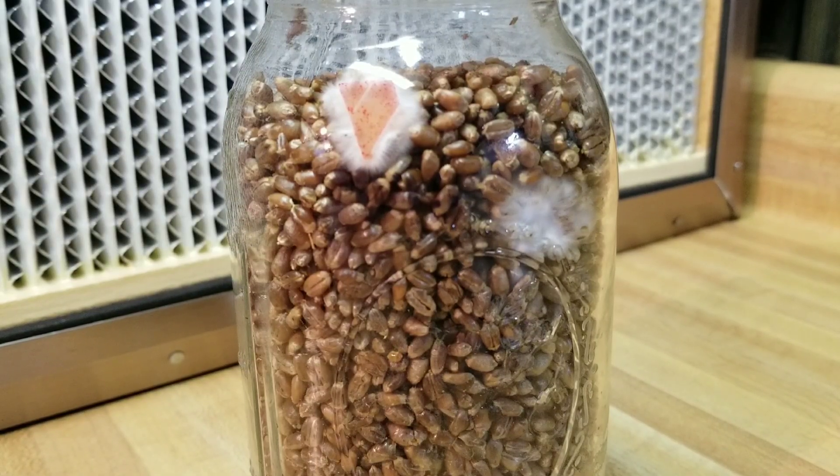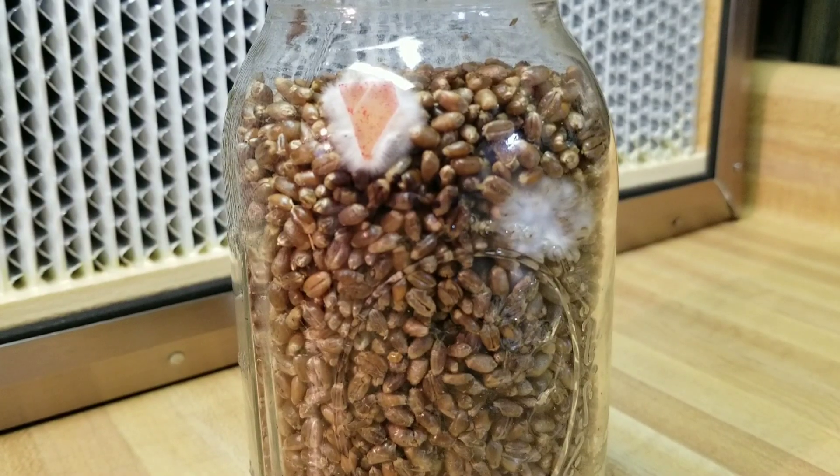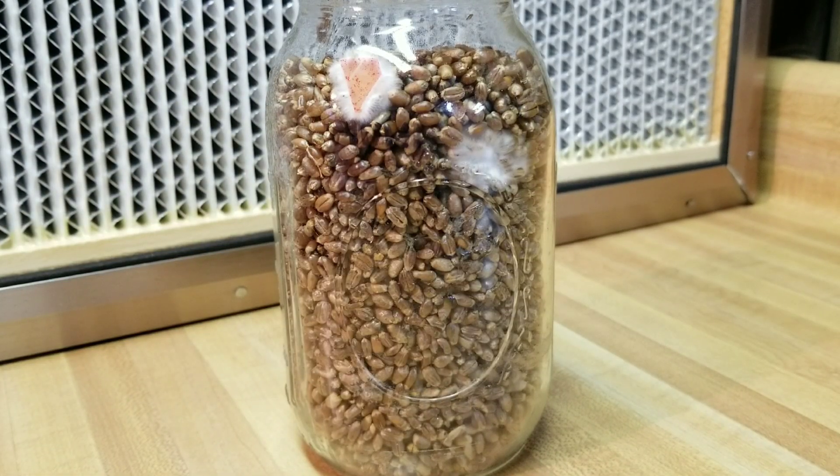That's just the difference of five days or so incubating in the tote, allowing everything to redistribute. What I typically do is allow these jars to get one-third to one-half colonized and then spritz them down with rubbing alcohol and give them another shake in front of the flow hood to redistribute all those colonized grain kernels around the jar - that's going to greatly speed up your colonization.